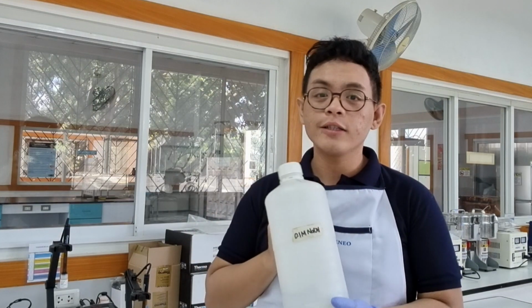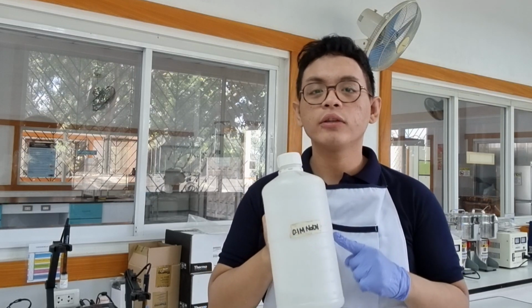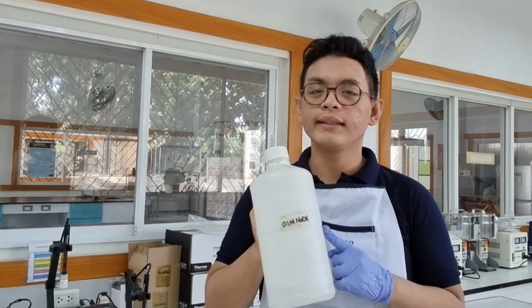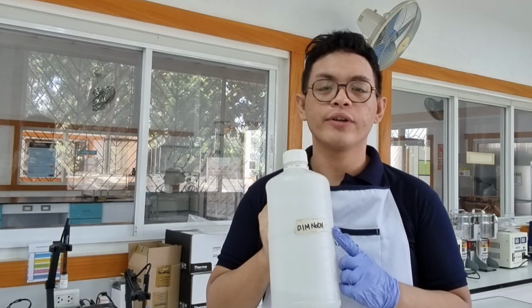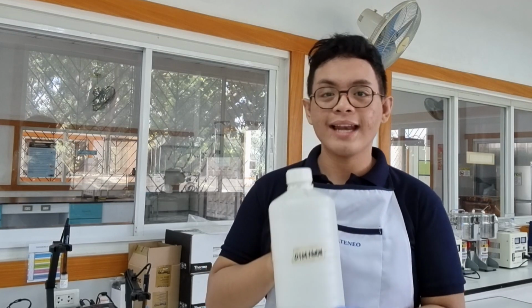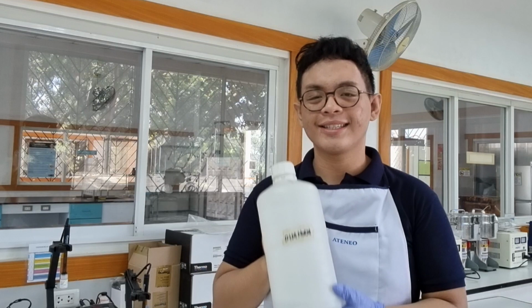Volume, as you might imagine, can be accurately measured in the laboratory using special glassware. But how do we make sure that the concentration of our acid or base is exact? We need to use standards. I have here a very non-suspicious container of 0.1 molar sodium hydroxide. I want to use this for my titration, but since I don't know who made this or when this was made, and I do not know the exact concentration, I want to convert this into a standard. So, this video will show you how I will standardize the sodium hydroxide solution.